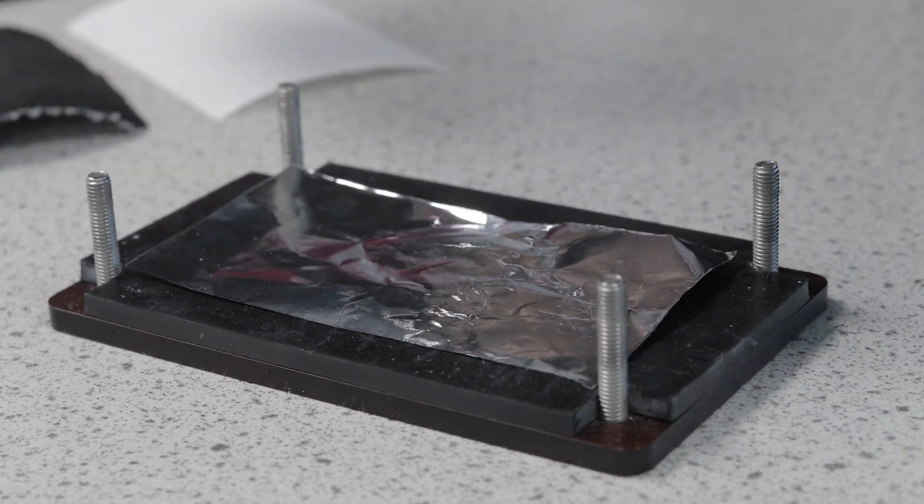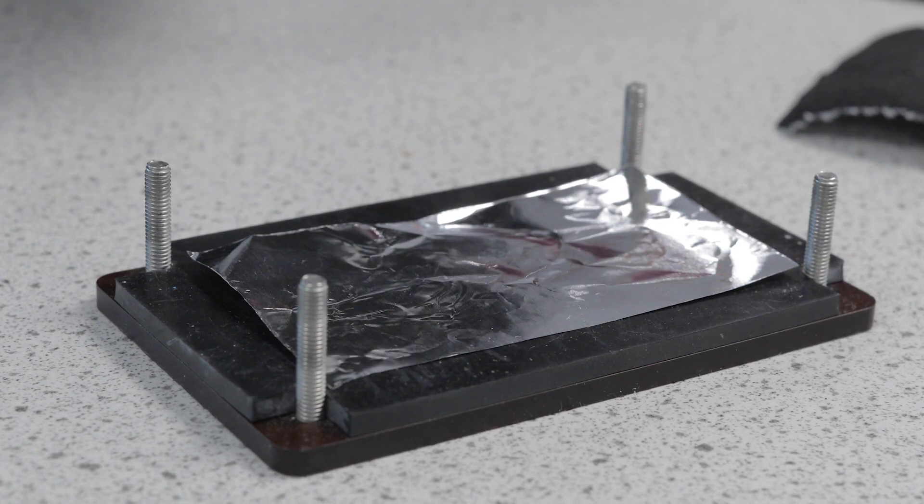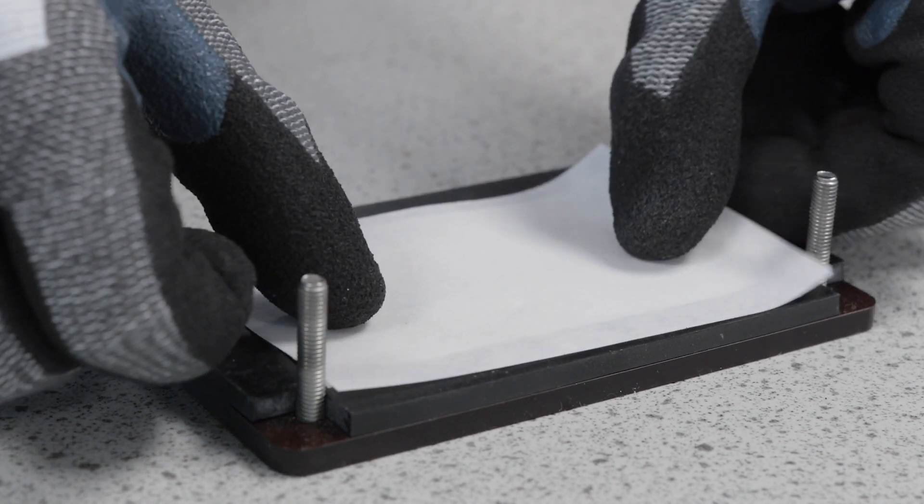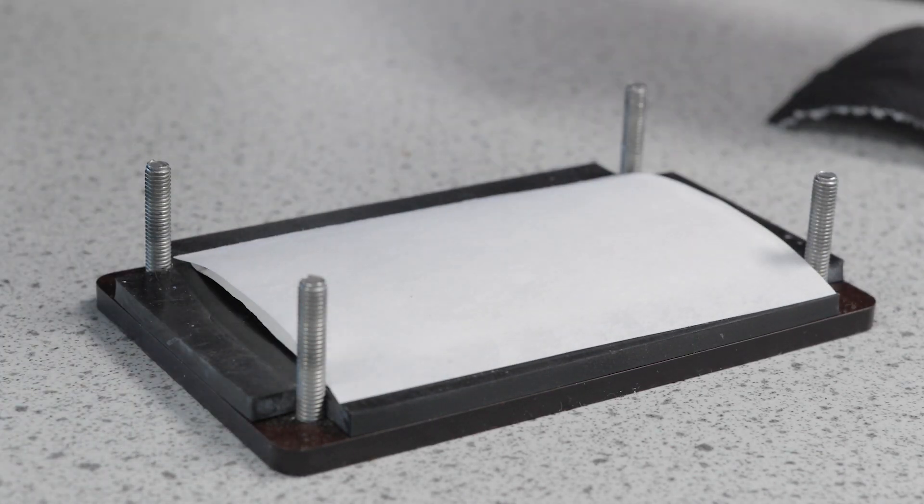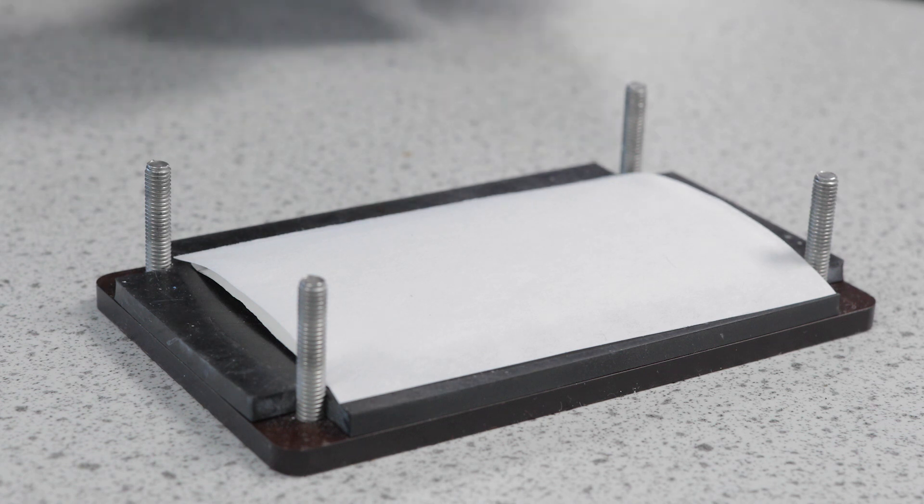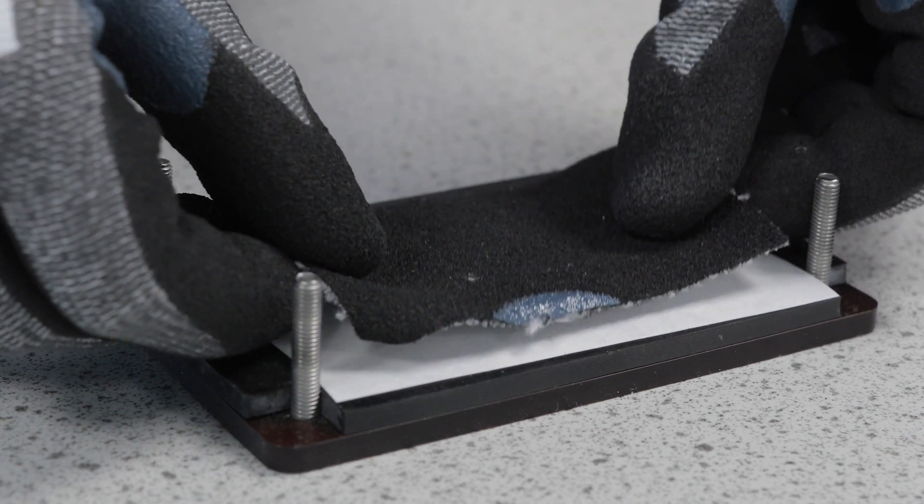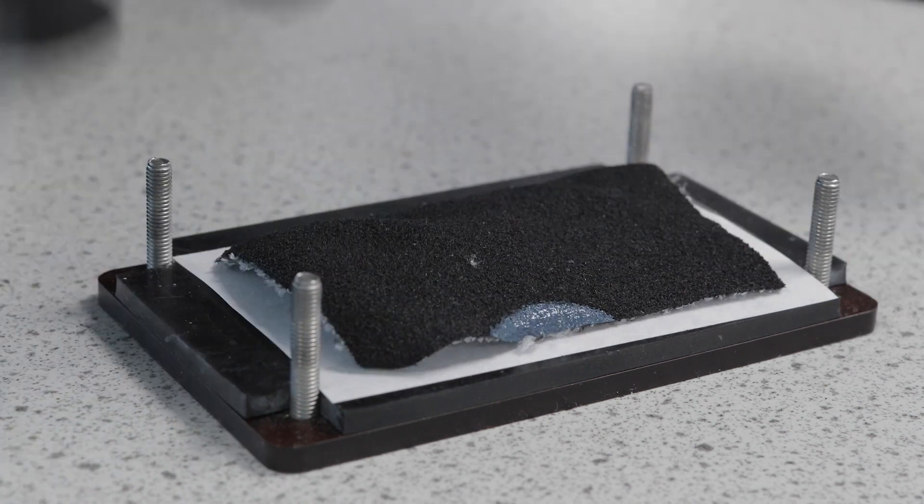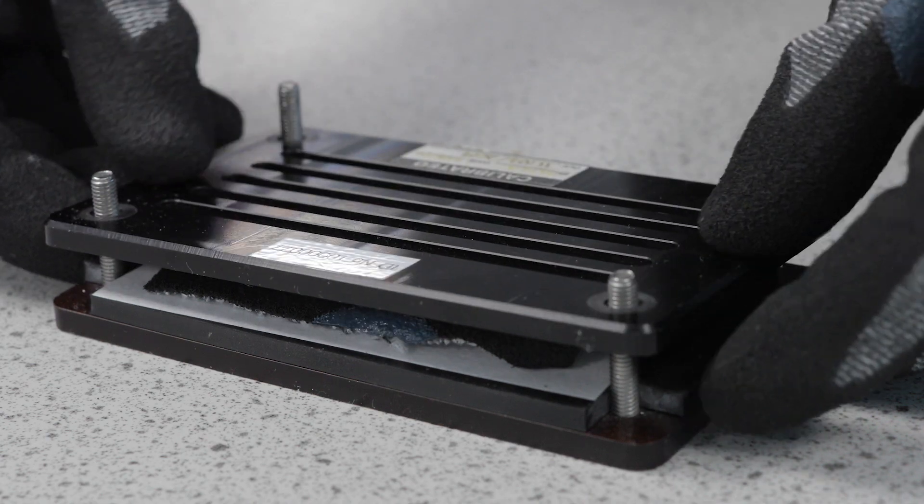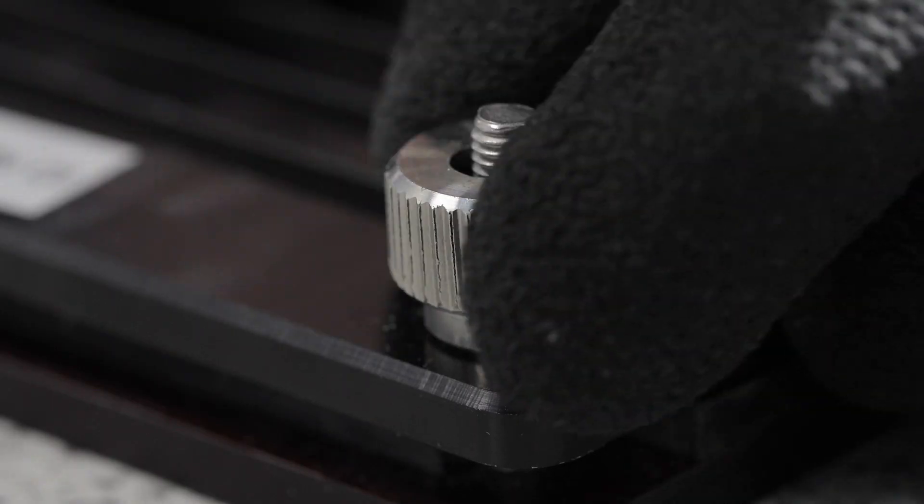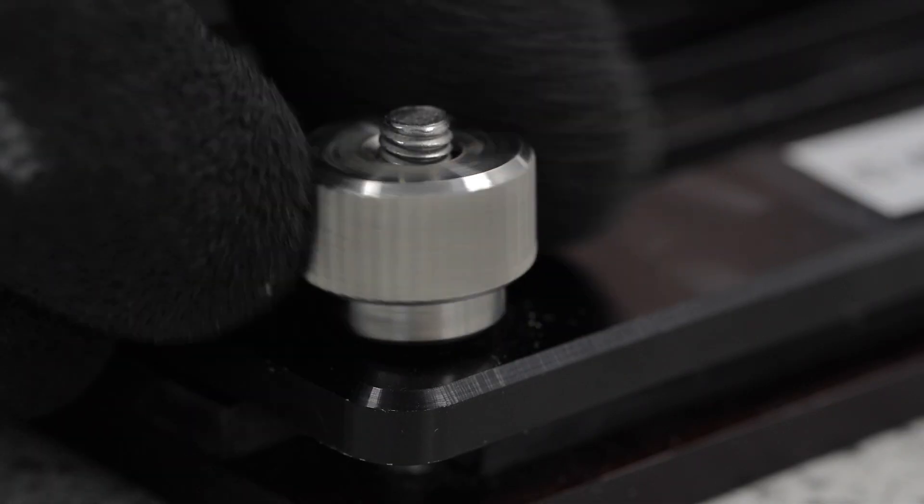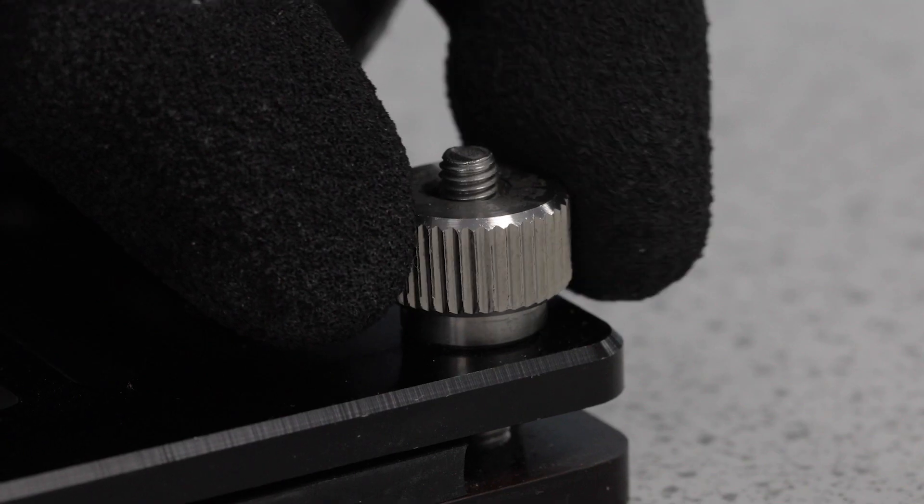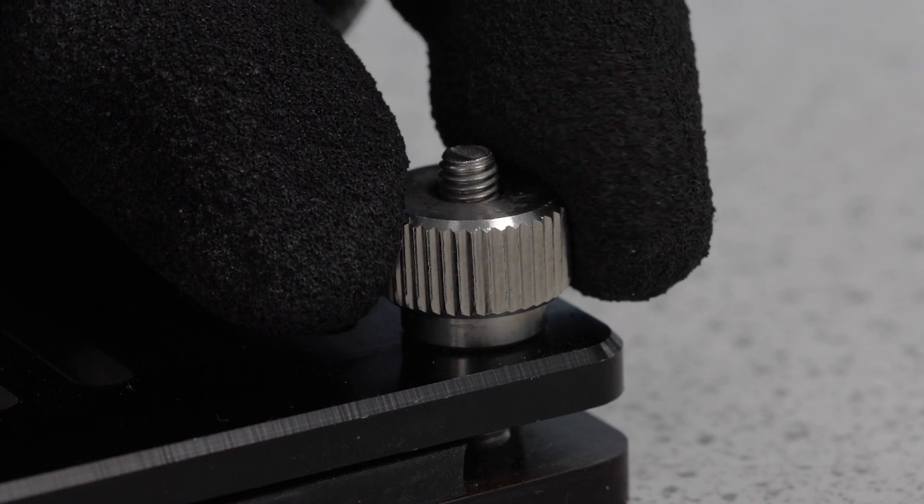A control sample material is tested both before and after testing the glove sample. In each case, the sample is clamped in a holder. The aluminum foil enables the coupe test machine to detect the moment of cut through by the blade.